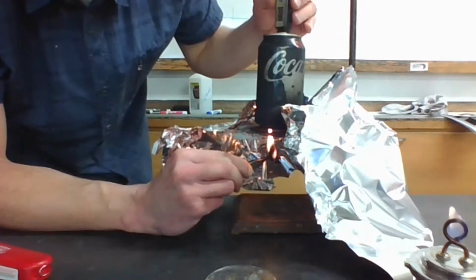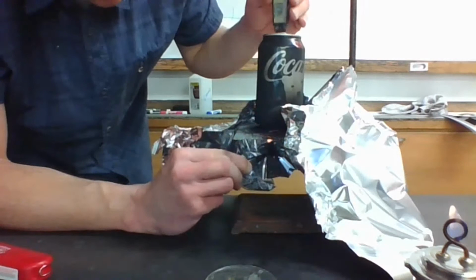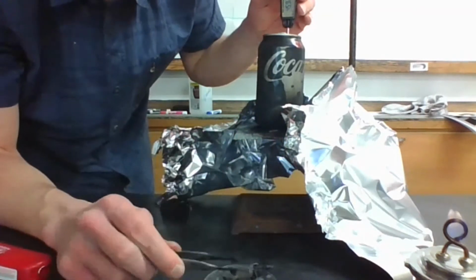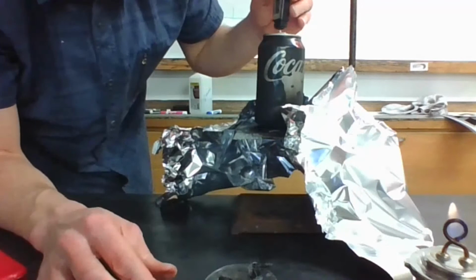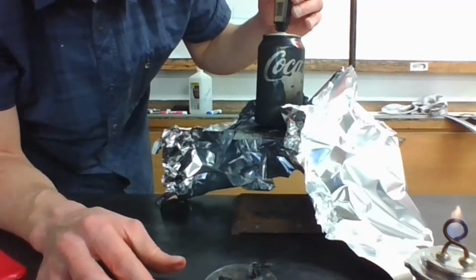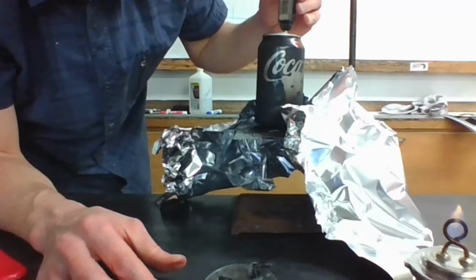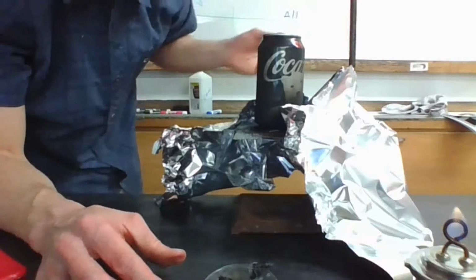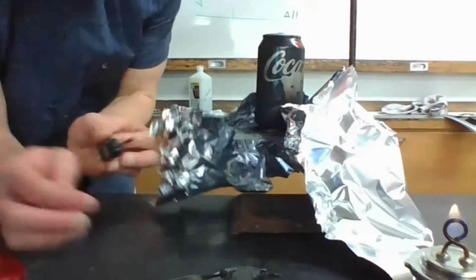Oh, it's getting pretty hot. We're at 45, 46. Okay. Going to go ahead and set all the pieces on here. I'm getting a high temperature of 46.7. Are we going to 46.8? Are we going to get any higher? Looks like 46.8 is going to be our maximum temperature.